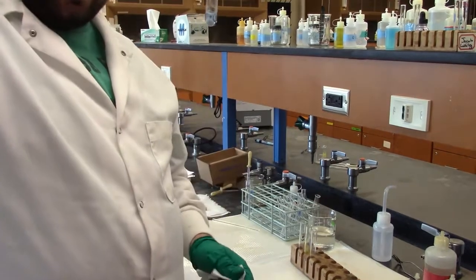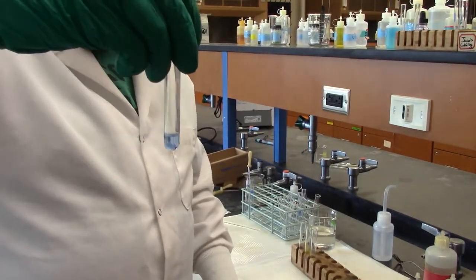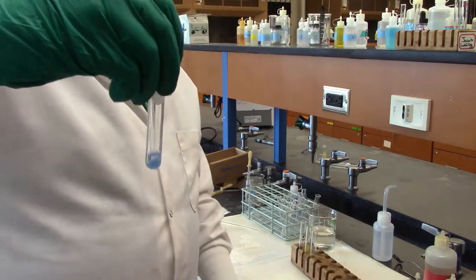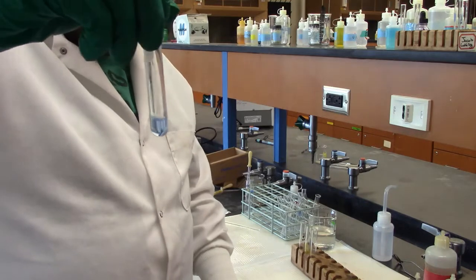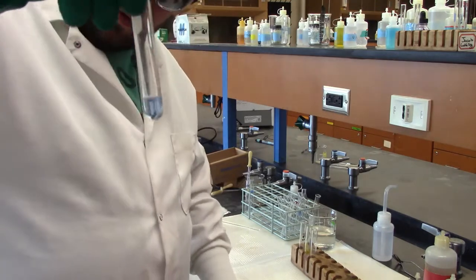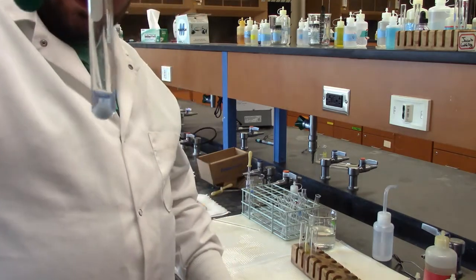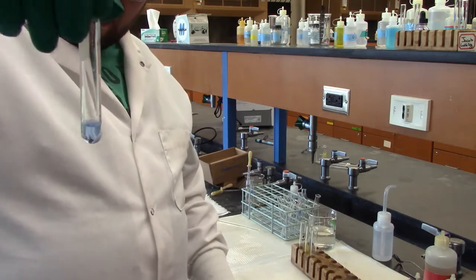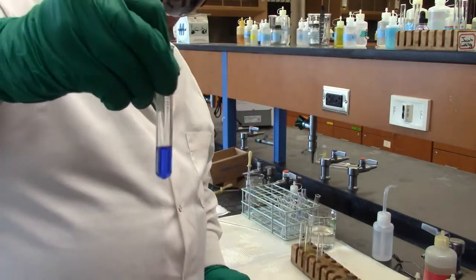Alright, so we took it out of the centrifuge, and you still have a bit of a pale blue solution in there, because not all of the copper came out, like I said, not perfect, but it's really pale blue, so it's mostly gone. If you look on the back side, there's our white precipitate, so that is the presence of our bismuth. So just to review, our bismuth is that white precipitate that came out. Our copper is our deep blue solution.